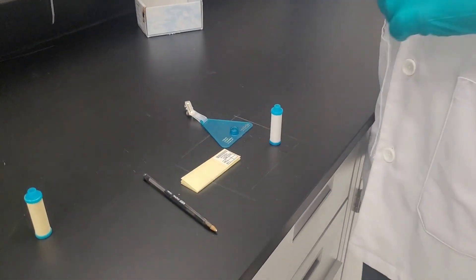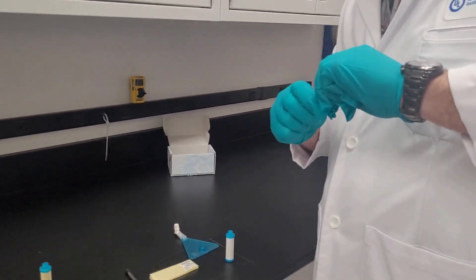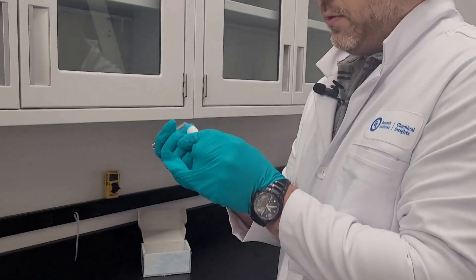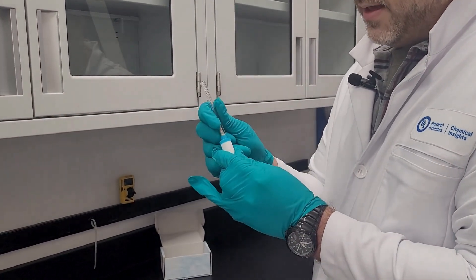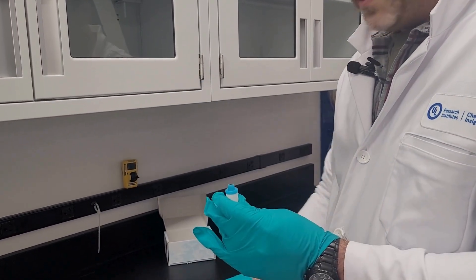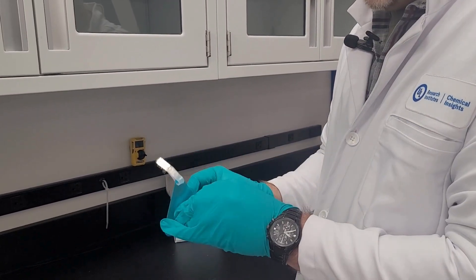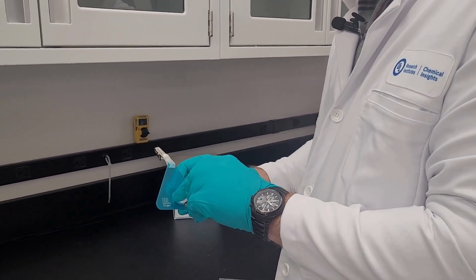So what we are going to do is take our sampling medium and carefully place it right over our tube minimizing the amount of VOCs that could come in contact. And then we are going to place the threaded end into there just like that.